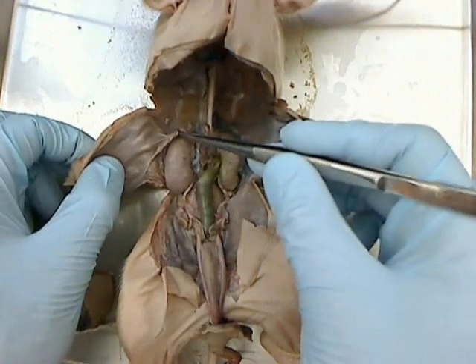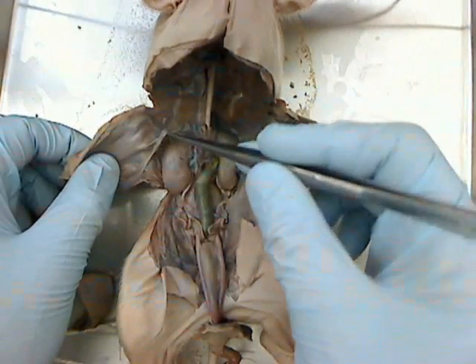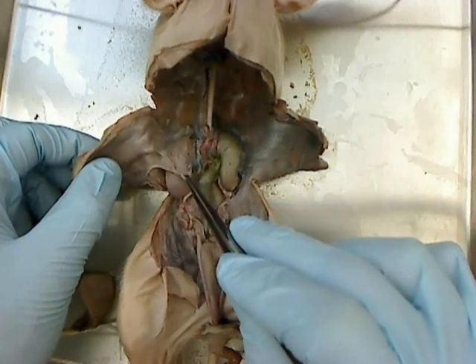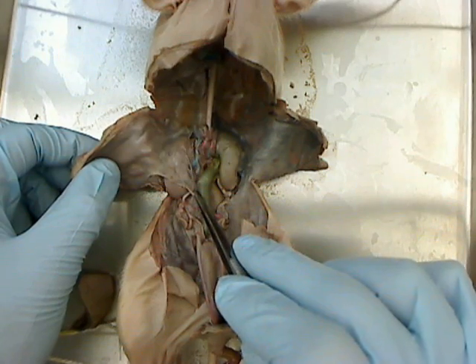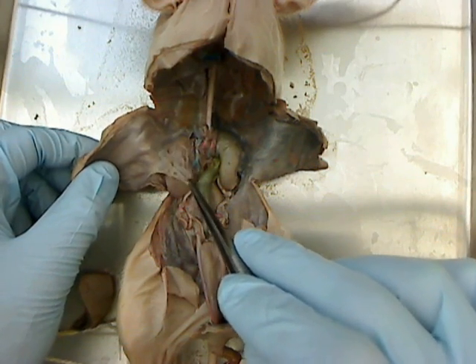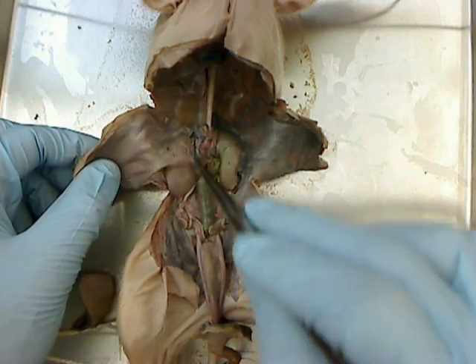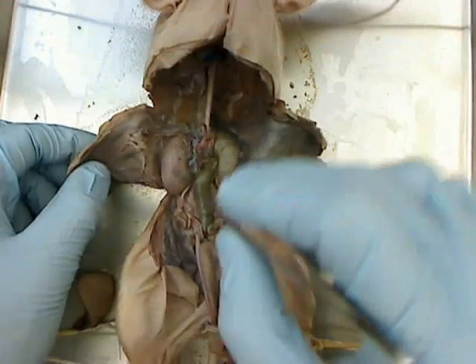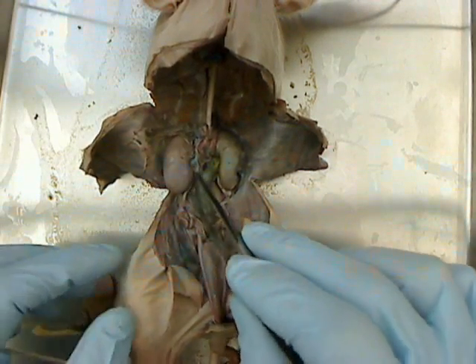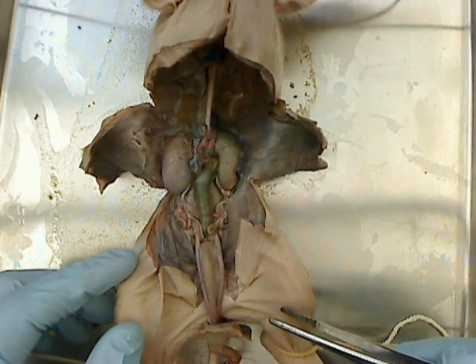This peritoneal membrane that I'm holding right now with the forceps covered the kidneys. In fact, I can put it back over like that. That just shows once again that the kidneys are retroperitoneal — they're underneath the parietal peritoneum in the back of the abdominal cavity.